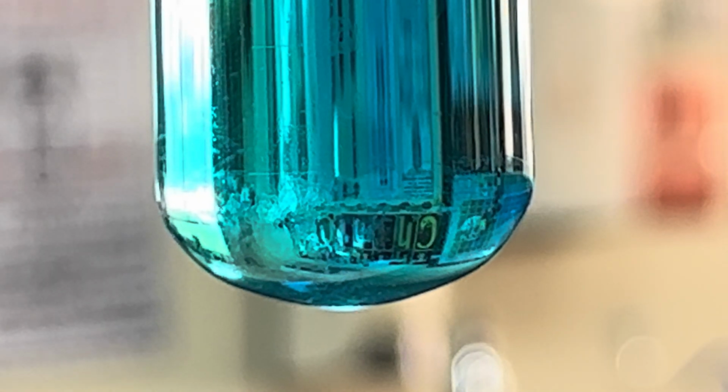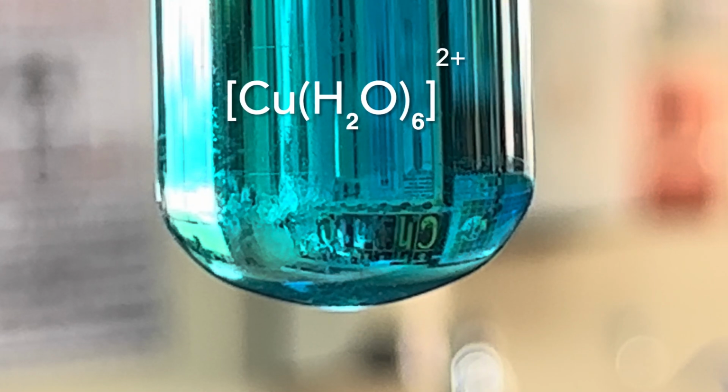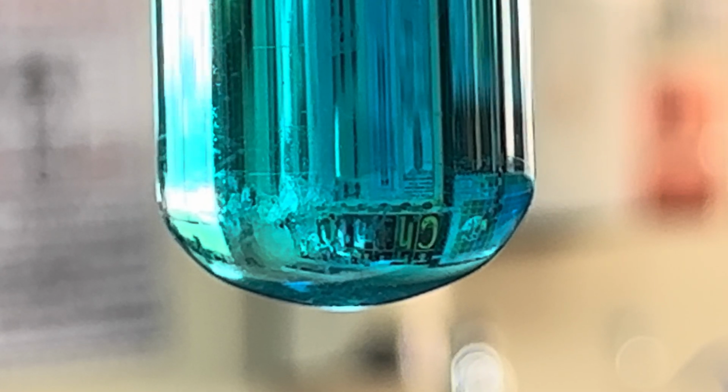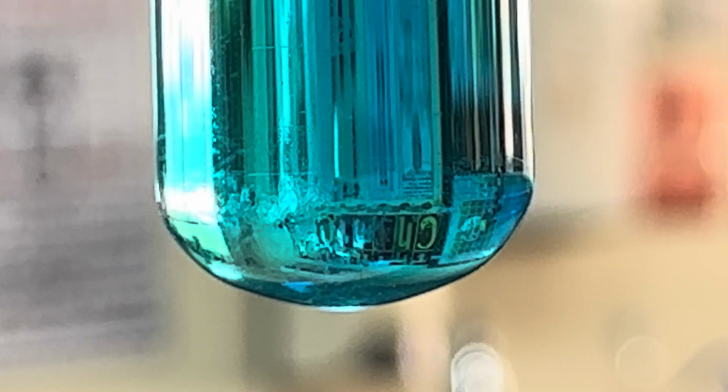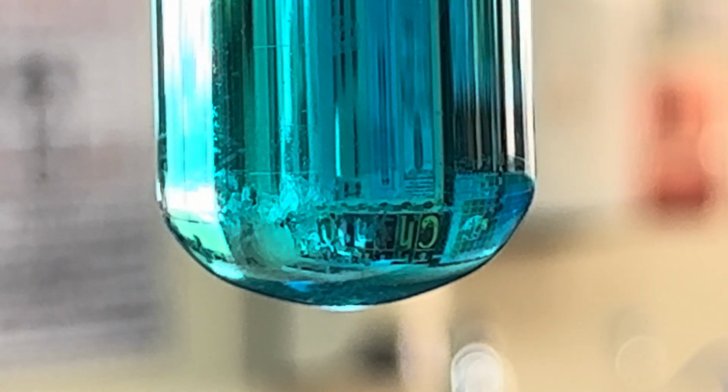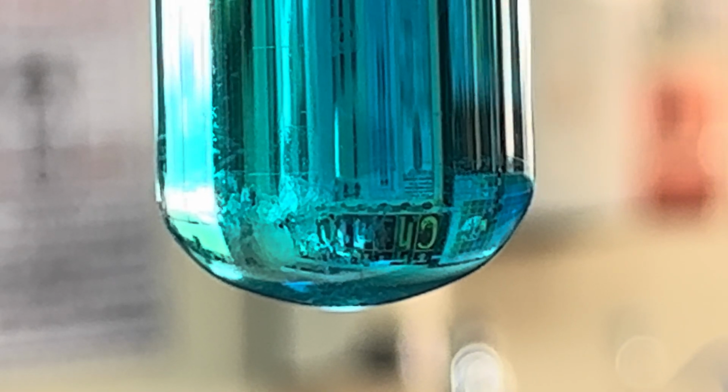You can see all the way through it, and that is because each of the copper-2 plus ions in this solution is stable and surrounded by 6 water molecules that are donating their electron pairs into the copper-2 plus ions. Now, we actually give a name for that. We call that ligands, and the ligands in this complex that you can see in front of us can be exchanged either wholly or partially for other ligands.